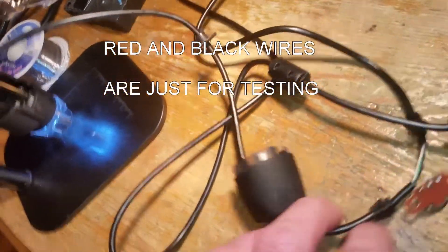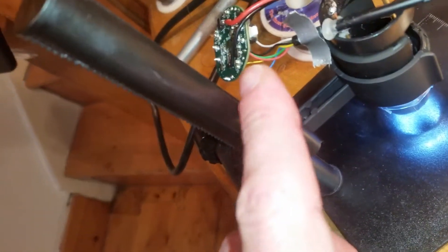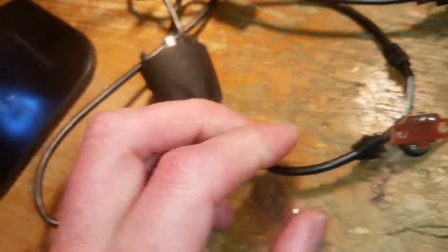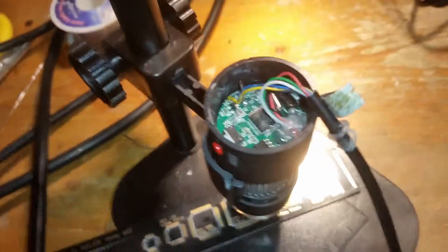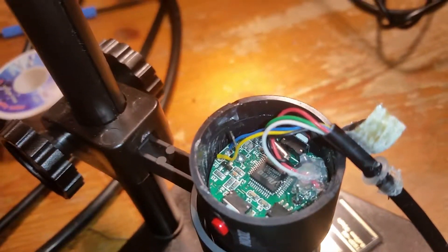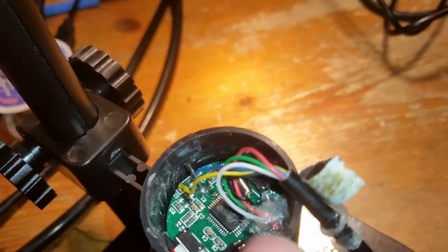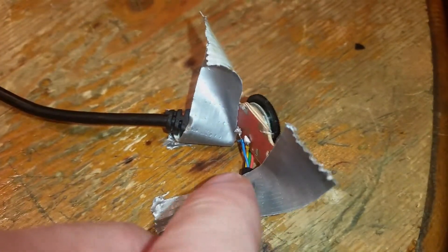I'll find it - it's underneath the computer at the moment. The dimmer is fixed. The dimmer is the two - the green and the yellow wire - which go back to this little pot on the cable. That's fixed. The LEDs are powered off those bars, so you've just got to figure something out there and we should be good to go. It's all back in, all reassembled. Put a couple of solder-tinned wires on just to guide it in and then locked it onto the posts, so the lights are all connected all the way up. Then just hot glue - I'm going to reinforce these because there's no strain relief. The dimmer was round the wrong way but I've put it round the other way and it doesn't make any difference, so I'm going to put it back as it was.